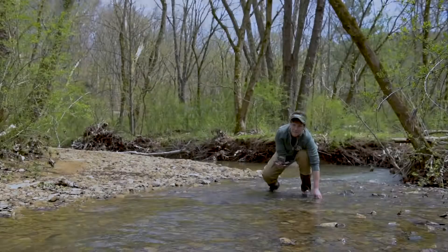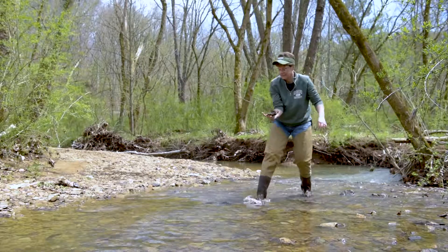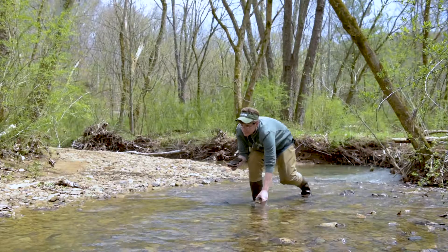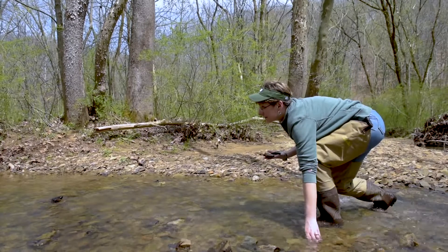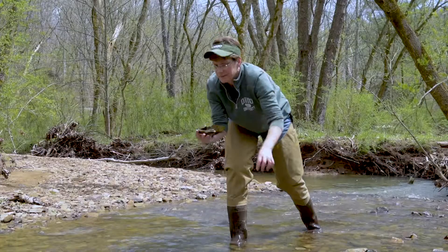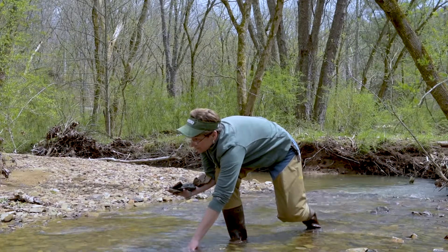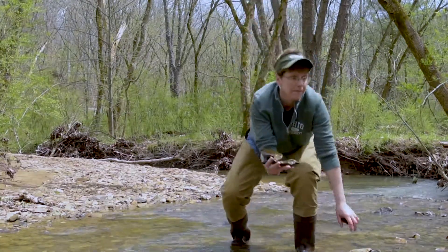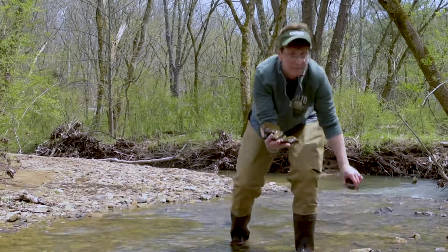Here you see me randomly choosing ten rocks. We start at the downstream end of the riffle and walk upstream. This is done so that we don't make the water cloudy or disturb the rocks we will be picking up to scrub. We want to make sure we sample random rocks, so as I walk upstream, I am not looking down, but instead I am picking up the first rock I touch so that our sample will be representative of the stream, and I have no bias in my sampling by looking for the rock with the most algae.